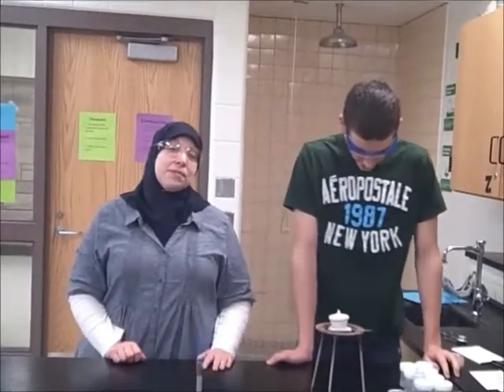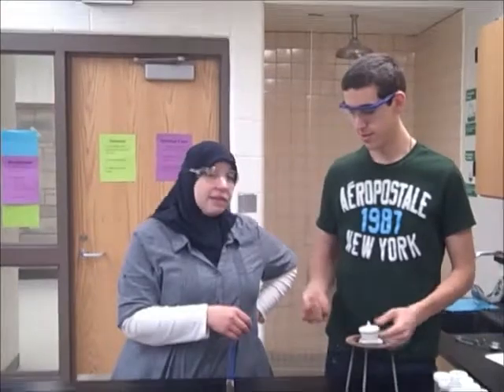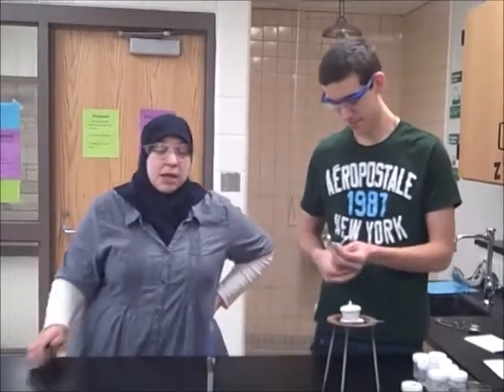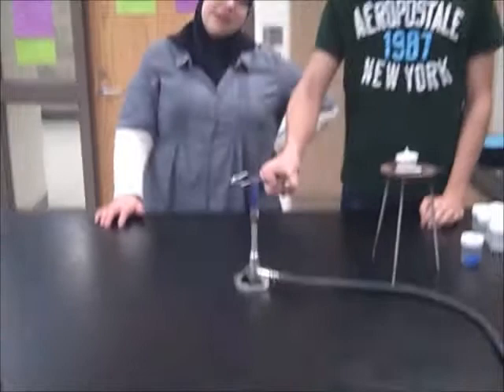And we're going to burn some magnesium. But we are missing something, Nick. Yeah, you see what we're missing? Yes. Magnesium is a metal, very nice, and unfortunately to put magnesium into the fire with your bare hands would be a bad idea. Putting magnesium in a fire without being a trained professional, oh yeah, it's a bad idea.